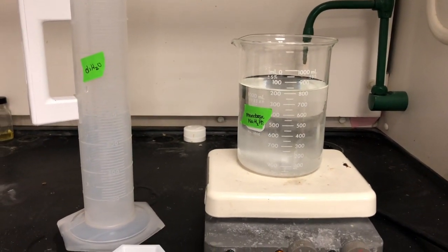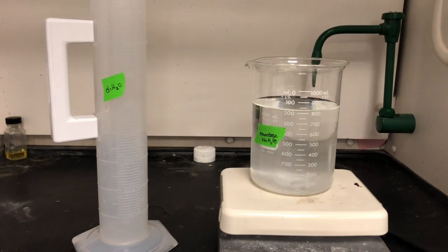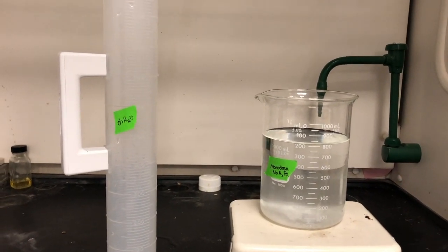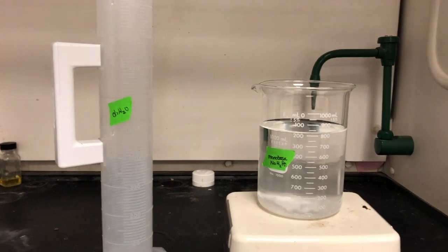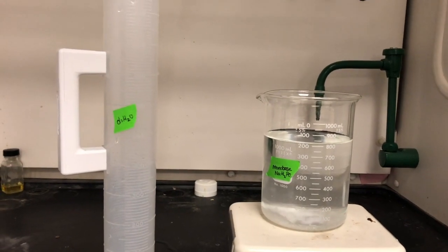And then after that, you're going to put it back into the graduated cylinder and then QS it to one liter.